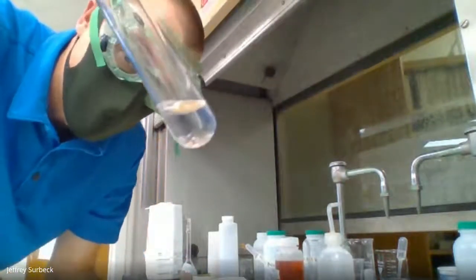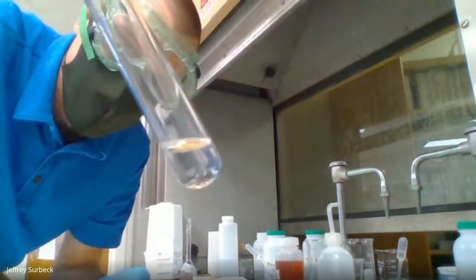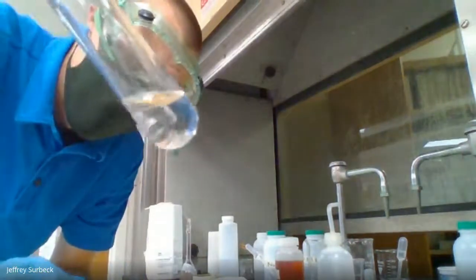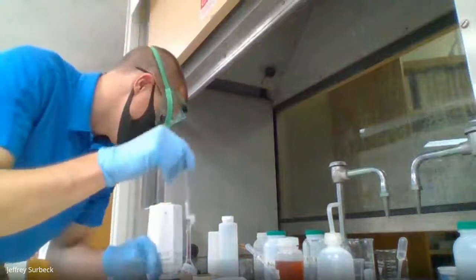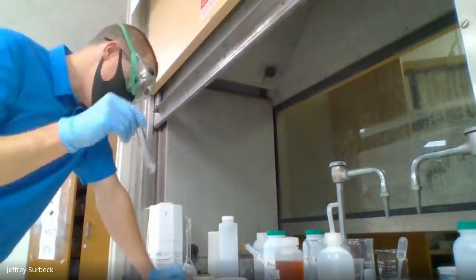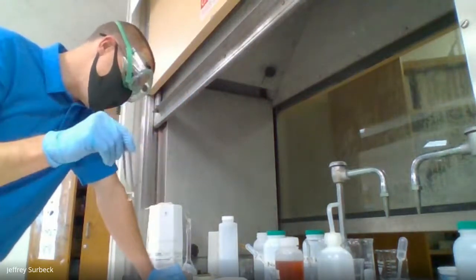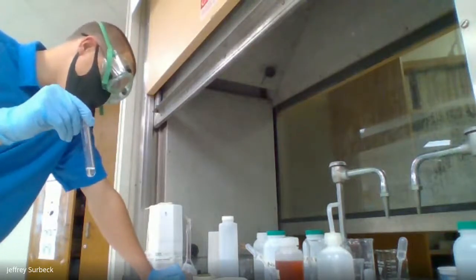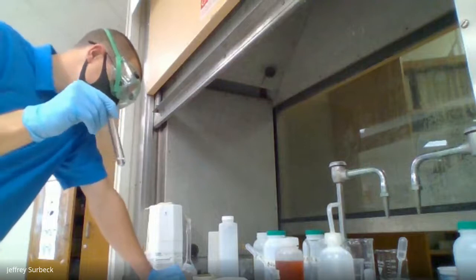So we started clear, we added the silver nitrate, it went to that milky white or that precipitate. Now we went back clear, okay? And that's because we added the nitric acid. This needs to go into number 12. Now what I'm going to do, I'm going to save this stuff here for our next steps in our problem here.